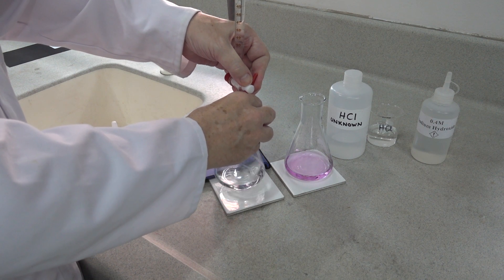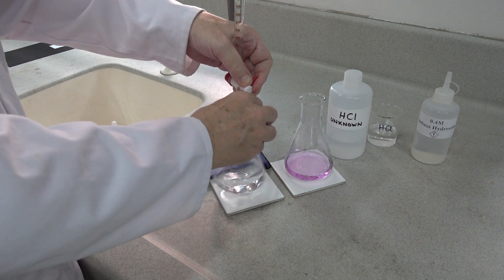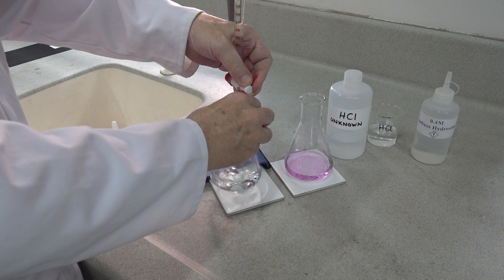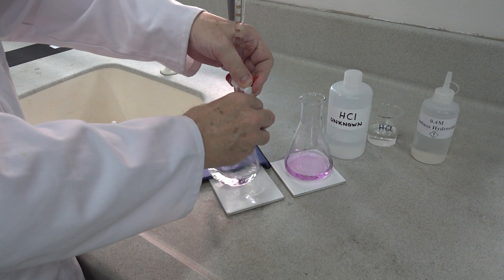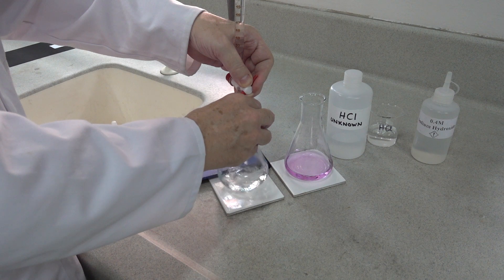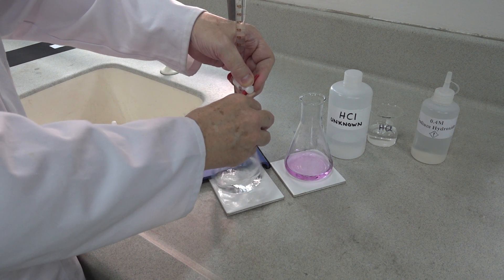Remember, this is a more accurate one, so we need to be careful as we approach the endpoint. The endpoint being the first pale pink coloration that persists in the conical flask.